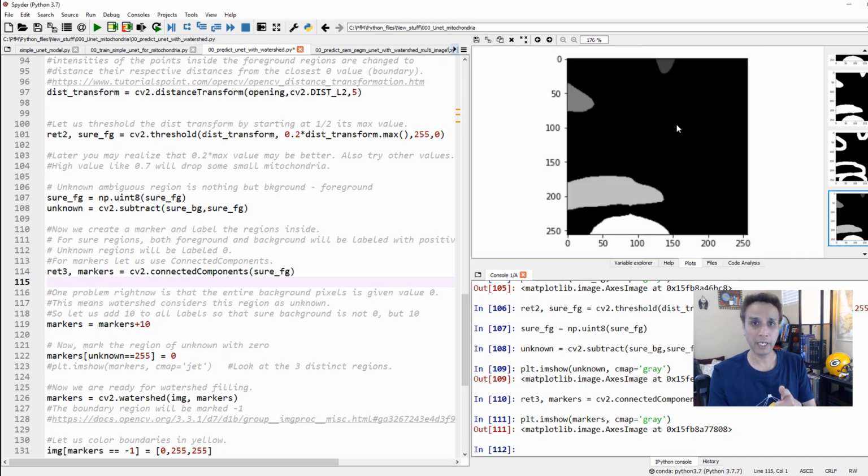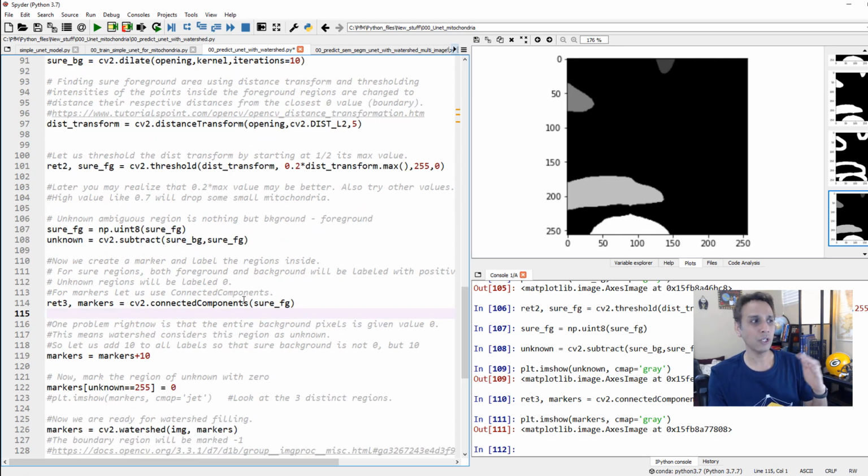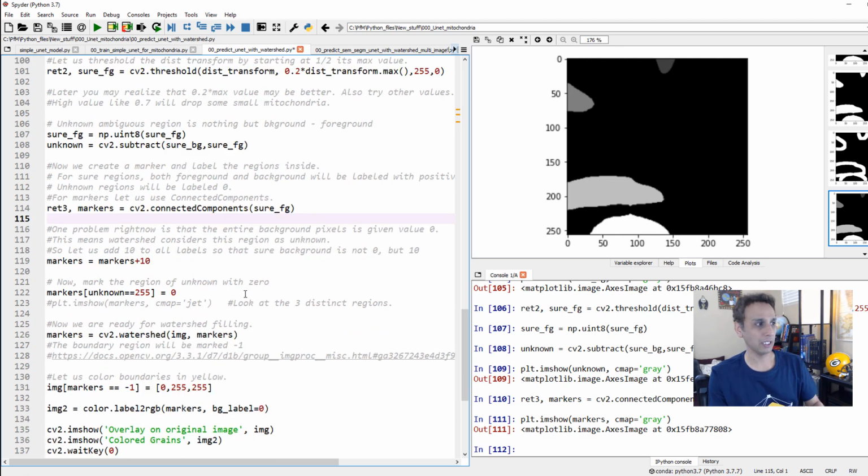Value of 0, background pixels 1, 2, 3, and 4, right? Now, later on, when we actually do this watershed, values of 0 are going to be a bit troublesome. So what we'll do is bump everything by a value of 10, meaning I want all my background pixels to have a value of 10, and all of these pixels to have values of 11, 12, 13, and 14. That's pretty much what we are trying to do.